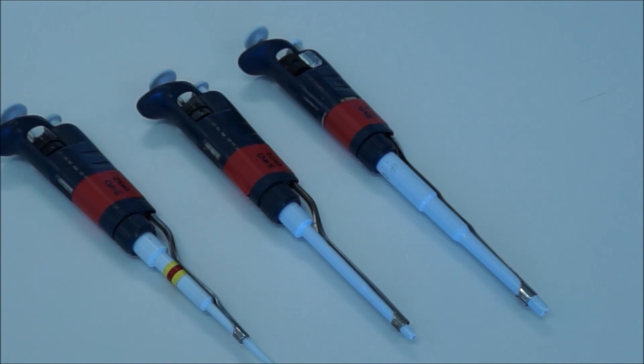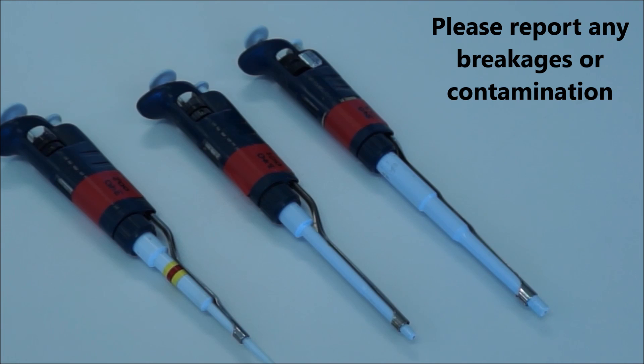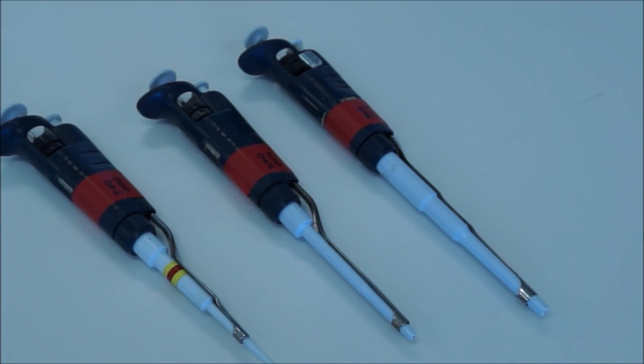It's really important to treat these with care. They cost upwards of $300. They're communal items. All the students in the labs are going to be using them, and so it really requires everyone to be very careful. If you do break them or if you get contamination in one of them, that's fine. We can clean them. Our technicians are able to service them, but just let us know.